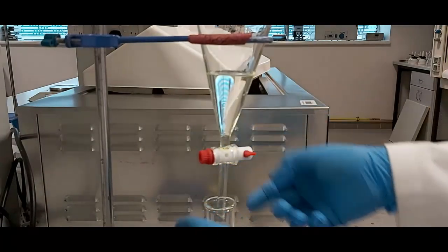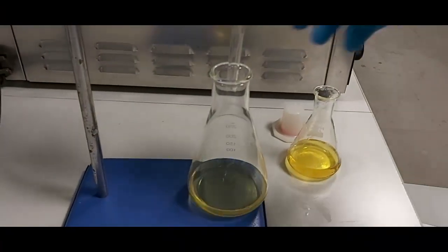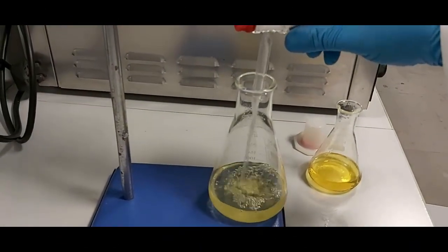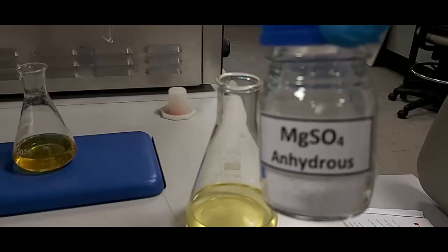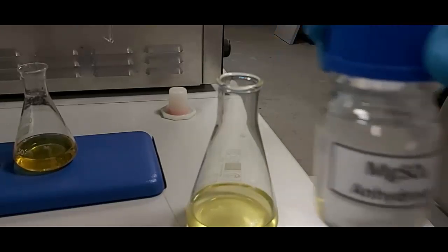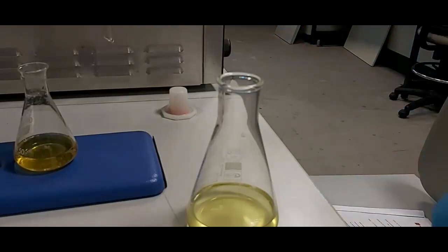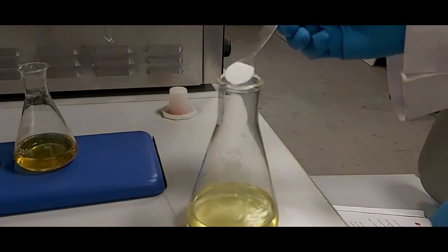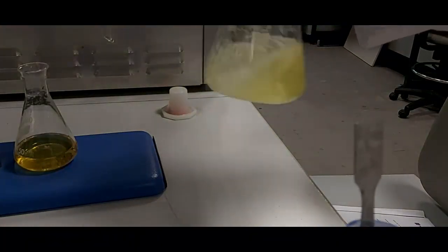I combine the second ether fraction with the first ether fraction. Then I add magnesium sulfate, MgSO4, to dry the small drops of water remaining from the extraction. I add a small amount and mix it in.